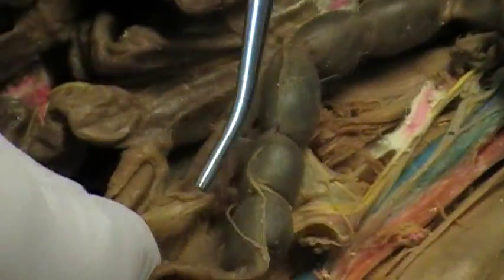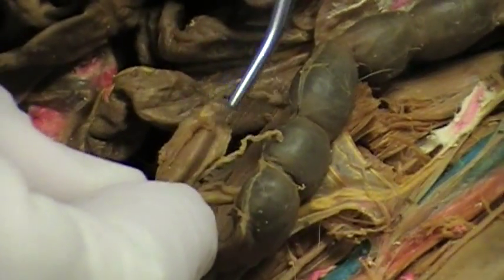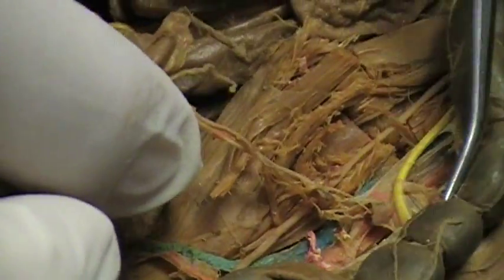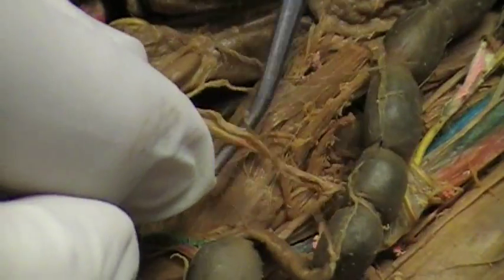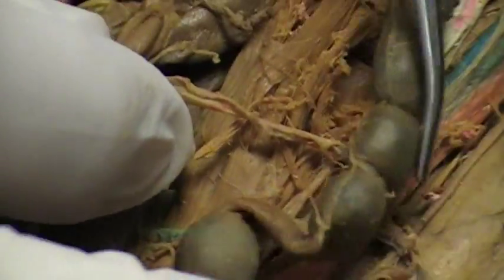Okay, this is the right uterine horn. The ovary is still here on this one — this is the ovary. There's not much left, but this would have been the artery and vein right here. So they come off right here, and another side comes off right there.